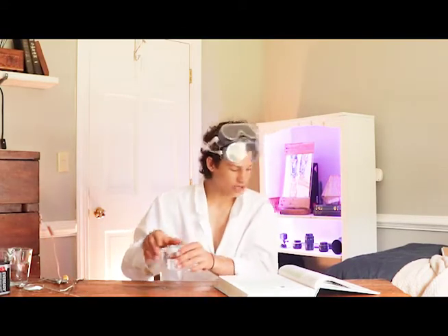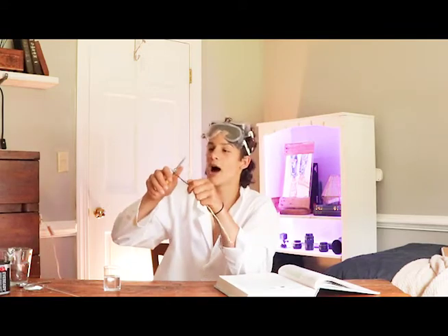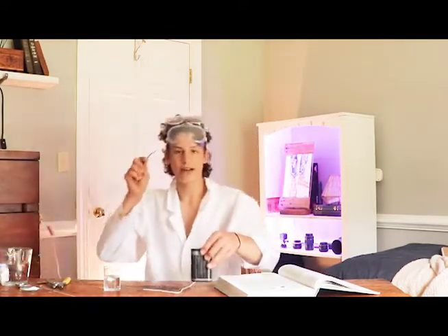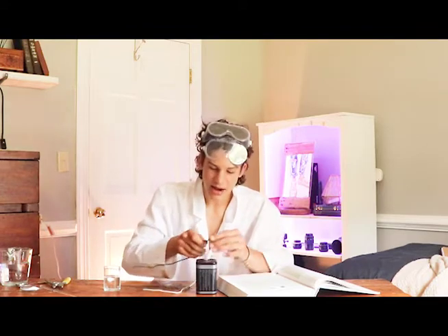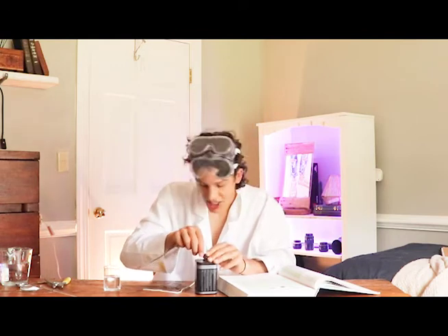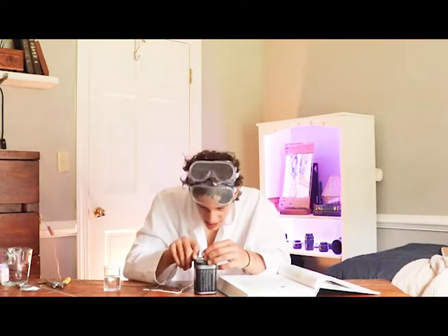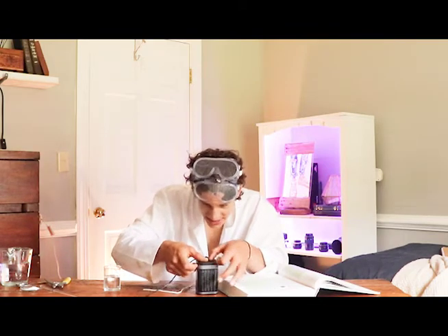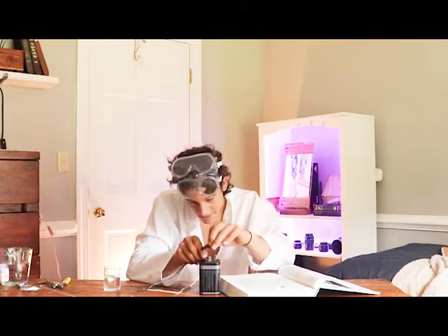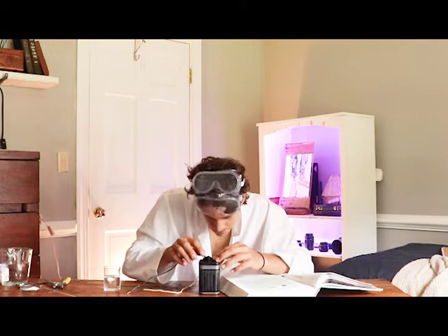After you have your water, you're going to take your two wires, and if they aren't already stripped, take your wire strippers and simply strip some of the insulation off. You're going to want about 2 centimeters of bare wire on both ends. Now you're going to take your wires and your 9 volt battery, and kind of wad your wires up into sort of a spiral-y thing, and shove it down in there. It's important that you are touching the battery outlet with your wire. Bend it a little bit just to make sure it's touching. Then take a piece of black electrical tape and tape it on there real tight, so you know it's going to stay touching the outlet. If it's not touching, your experiment will not work.